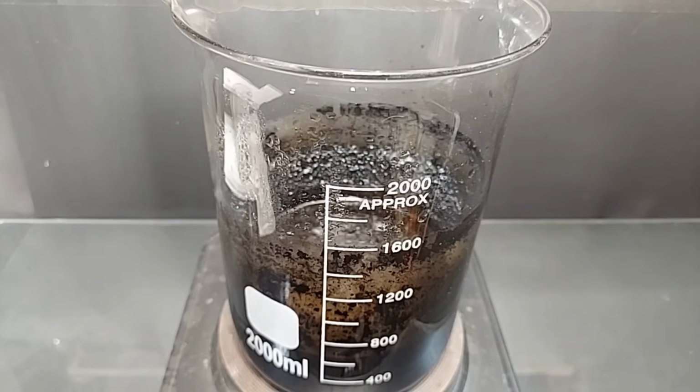Believe it or not, it kind of smells like caramel topping. I'm just saying. It does smell like that, like a lot. Just, it's kind of weird. Nothing settled over that 6 or 7 hours, so there's nothing really to decant. You can see stuff floating on the top even. So I need to filter this off camera because I'm not going to bore you with that. You've seen that already a couple times. So it just needs to be cleaned up so that we can distill it properly.